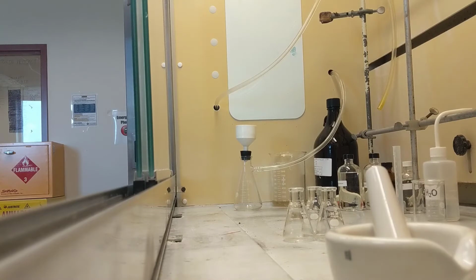Alright guys, with all that said and read, we're going to go ahead and start on part A of experiment 15. Because I don't have access to a centrifuge and I don't want to do a centrifugation, we're going to be using a different process for extracting them in part A. But after we do that, we're going to do the same thing as written in parts B and C in your books. So let's get started with experiment 15, starting at part A, the extraction.